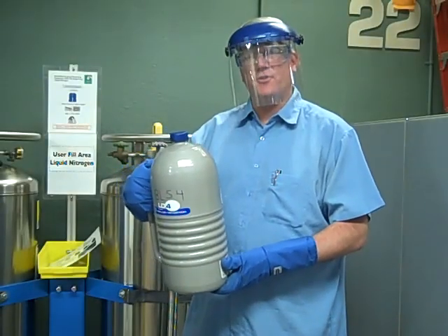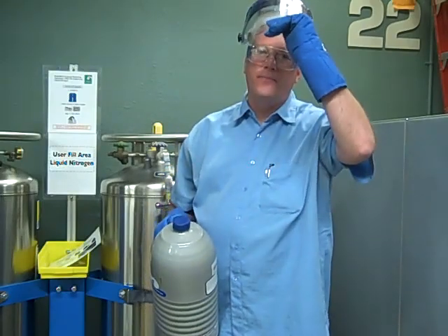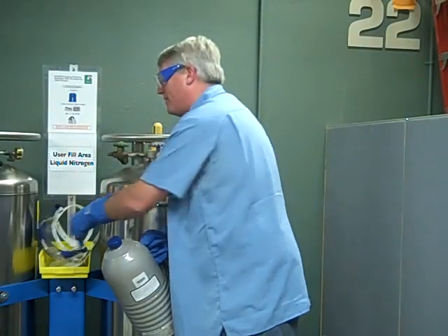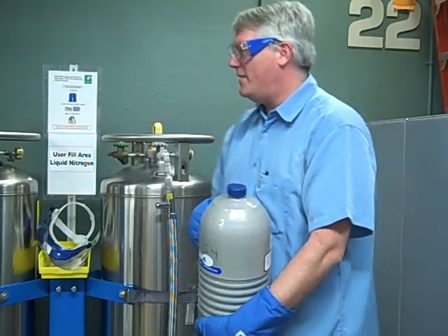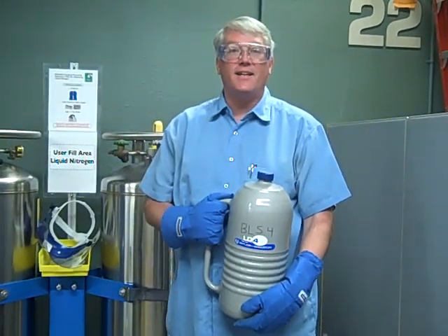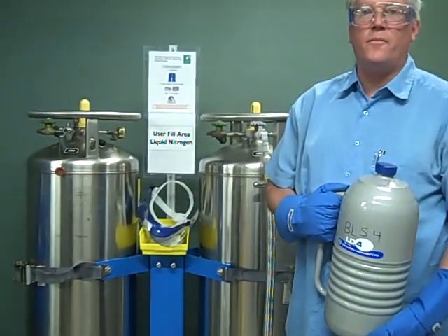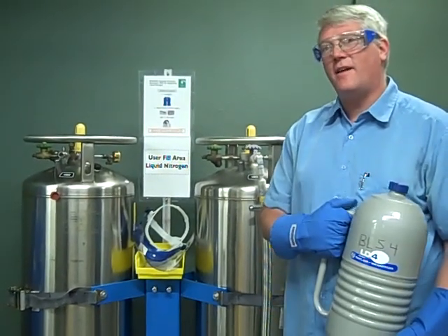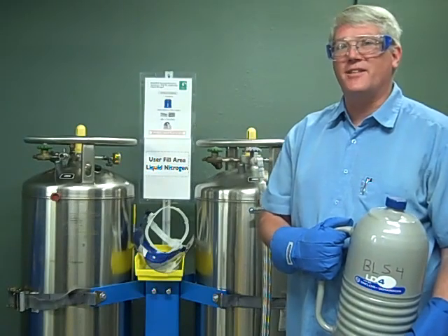So now we've filled up the liquid nitrogen dewar. The cap is back on, so we can start taking off our safety equipment. Be sure to leave the face shield and the rest of the safety equipment here for the next person coming by. These dewars are kept maintained full by somebody else at the ALS, so if you ever find one that's not full, you can always call the control room and they can make sure it gets filled up. If you have any questions at all about how to do this, feel free to ask myself or Hans or most anyone else around the ALS.